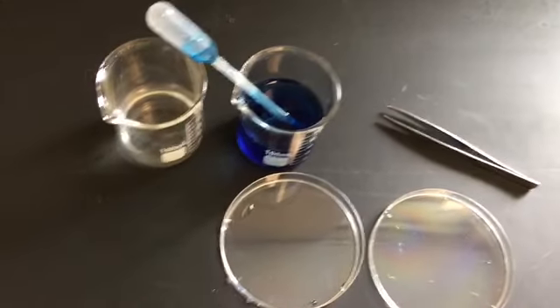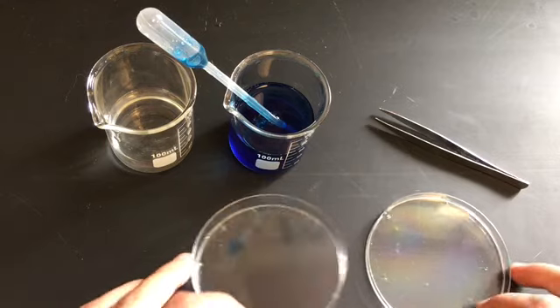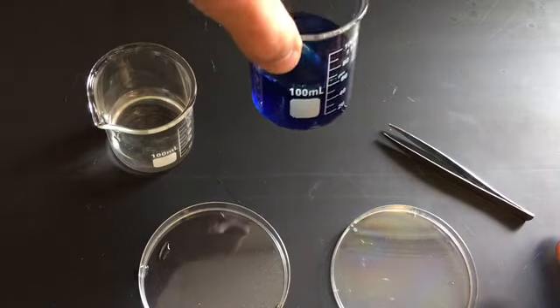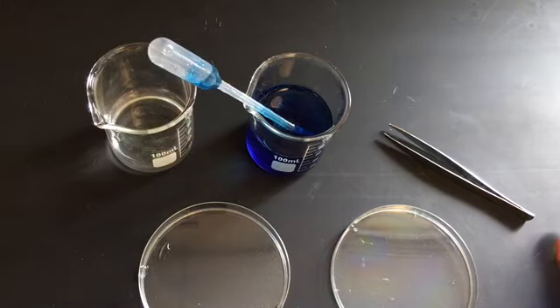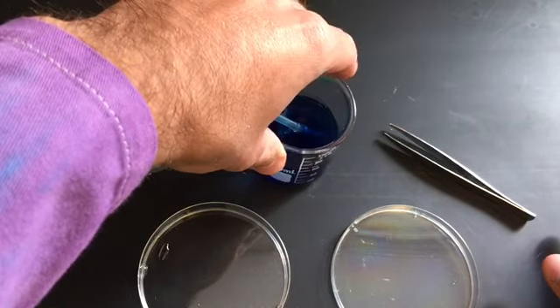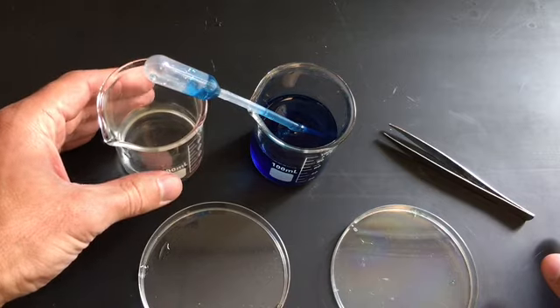You can see right away some of the materials I'm working with here. Let me just point some of these out. I have 2 empty Petri dishes. I have some forceps. I have a pipette here in a gooey substance called sodium alginate. It's explained in your lab what that is, but basically it's a material extracted from seaweed and algae that can be used as a nice thickening agent for foods.